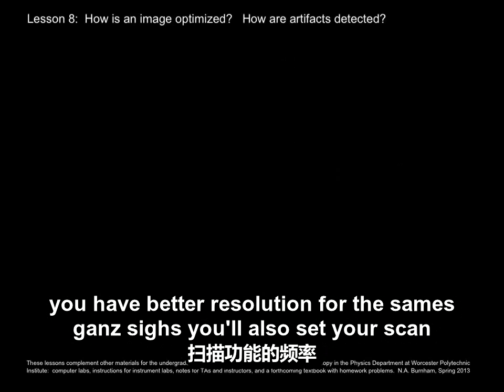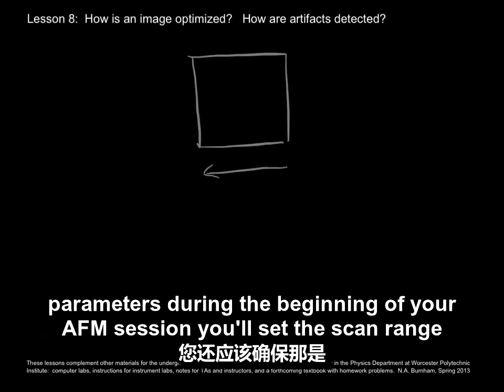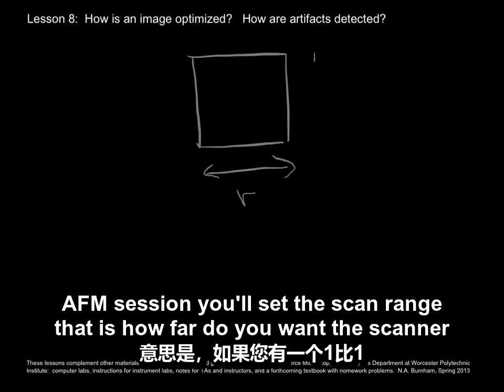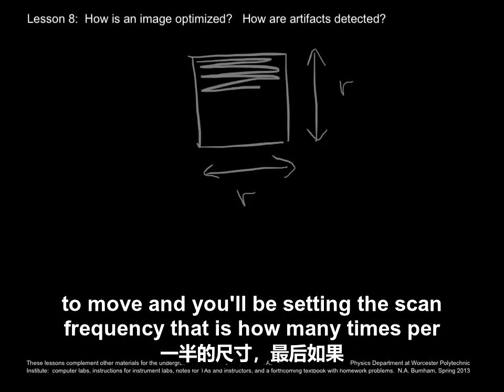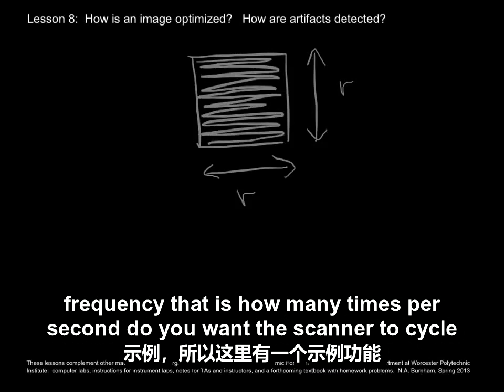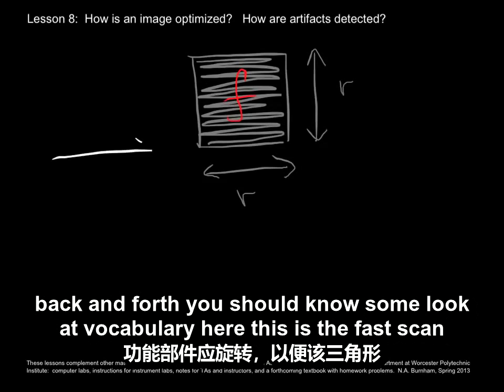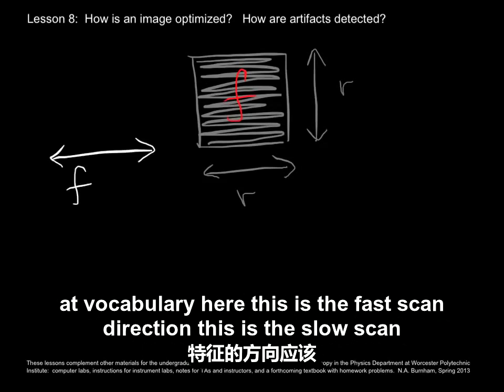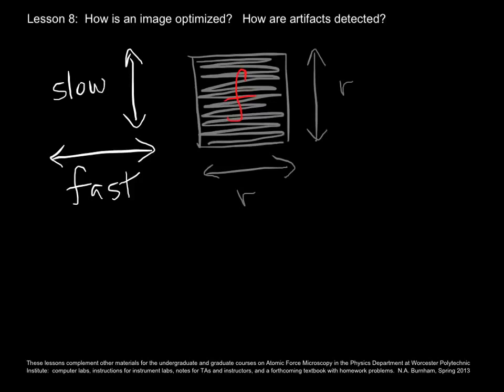You'll also set your scan parameters during the beginning of your AFM session. You'll set the scan range, that is, how far do you want the scanner to move, and you'll be setting the scan frequency, that is, how many times per second do you want the scanner to cycle back and forth. You should know some vocabulary here. This is the fast scan direction. This is the slow scan direction, the way I drew the path of the tip there.